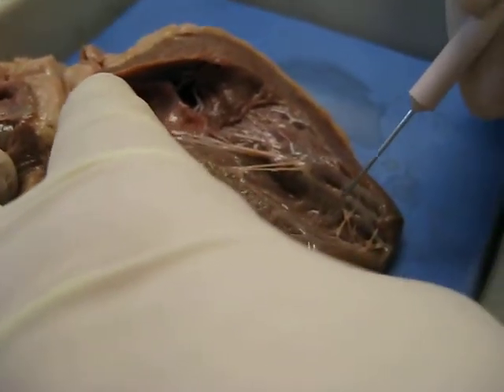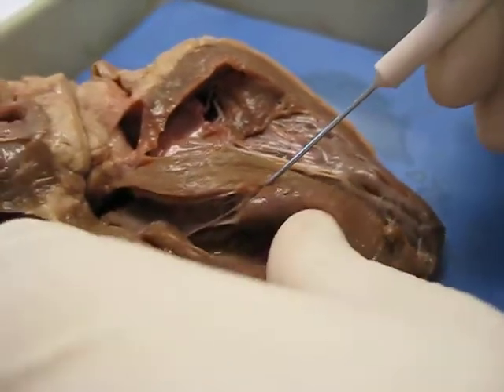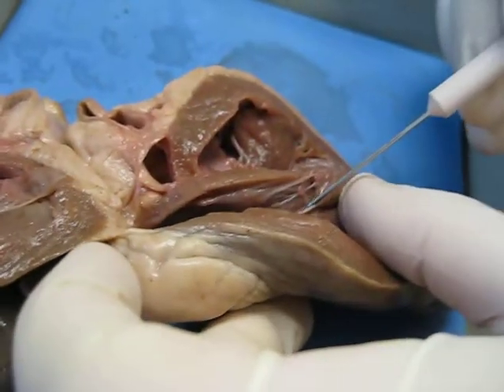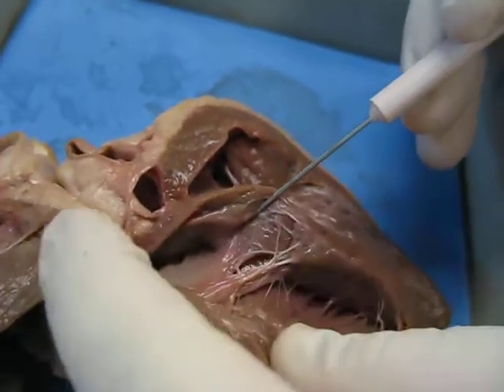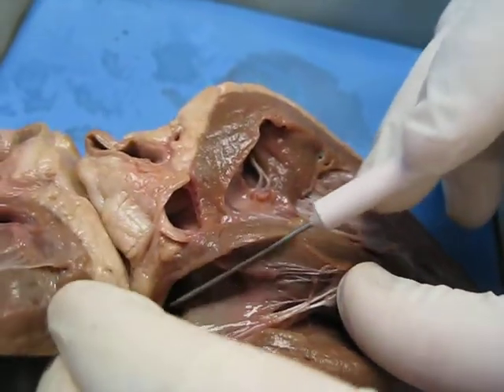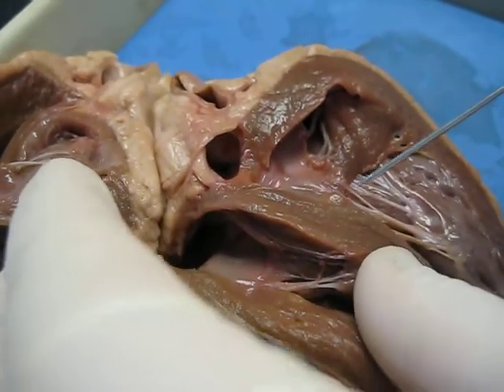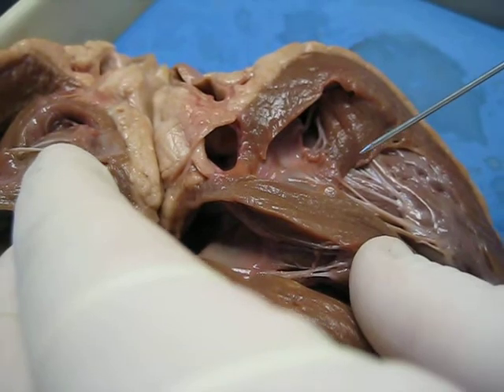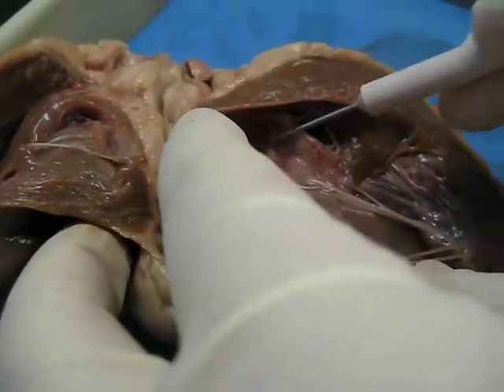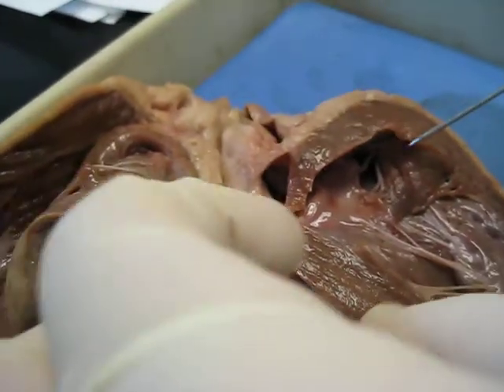Okay, and these are the chordae tendineae here that are attached down to the papillary muscle. You see the little wrinkled surface here? That's going to be the trabeculae carneae. Come over here, and we have much of the same as far as the chordae tendineae coming up to, in this case, the tricuspid, because we're on the right side. And past this valve up into here, this hollow chamber is what? Right atrium. Right atrium, exactly correct. And the chamber that we're going up into in here is the left atrium, exactly correct.